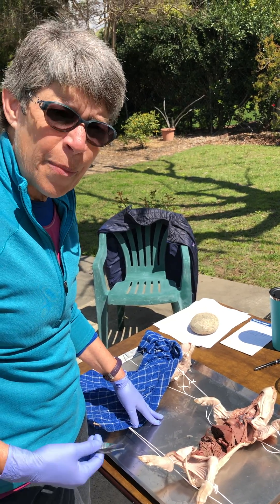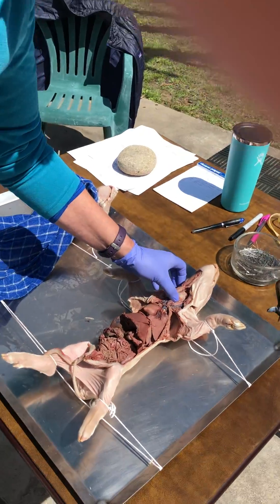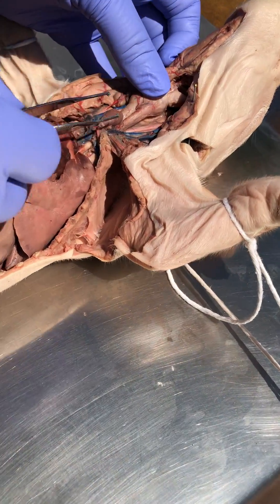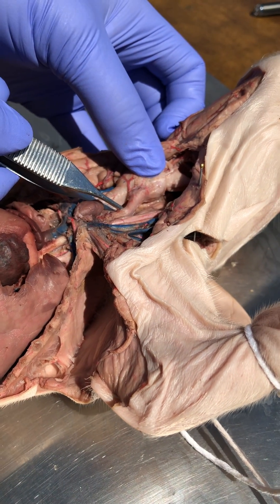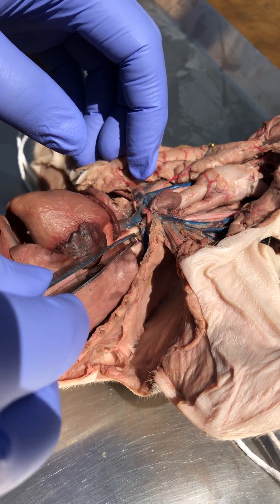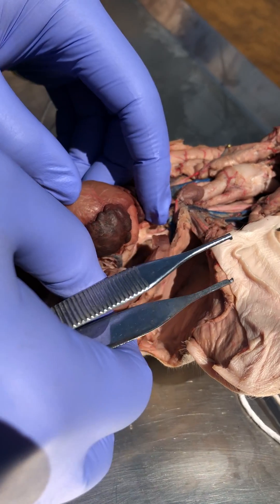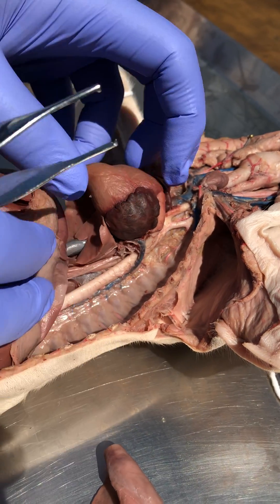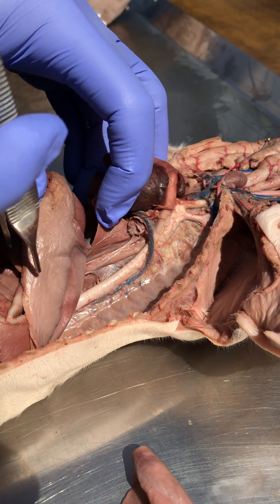Let's have a look at the digestive system from anterior to posterior, so anteriorly that is from the mouth. After a swallow, we're going to have material going down the esophagus. The esophagus is going to pass behind — because it's a dorsal structure — behind all of these circulatory structures, behind the respiratory structures, and we will see it now: there's the thoracic esophagus right here.